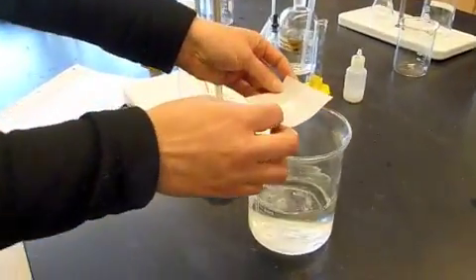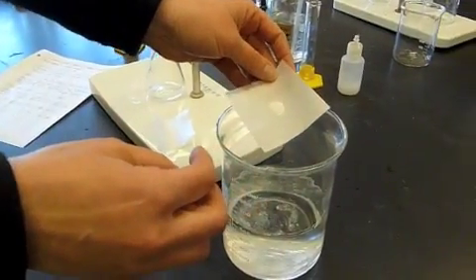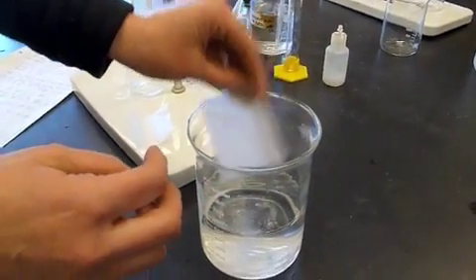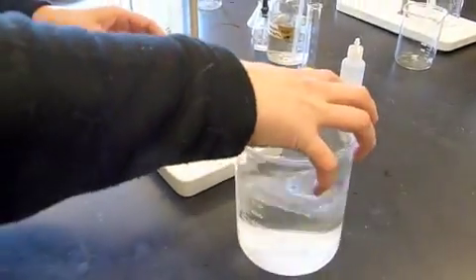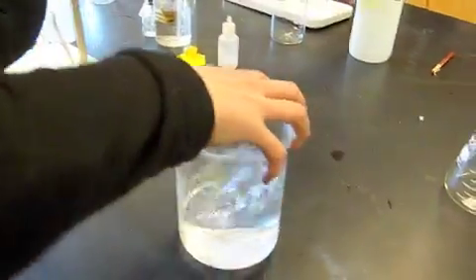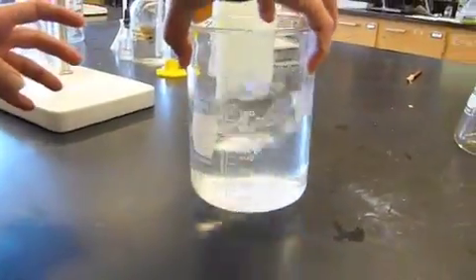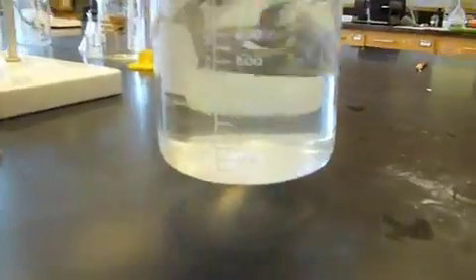This raises the pH of the solution and it reduces the reaction of the thiosulfate with the oxygen. We're going to swirl that real well just to make sure that it dissolves. You can kind of see that it gets down the bottom.